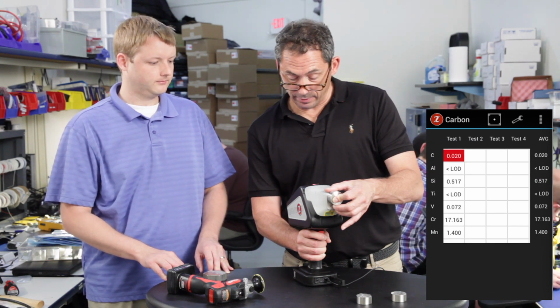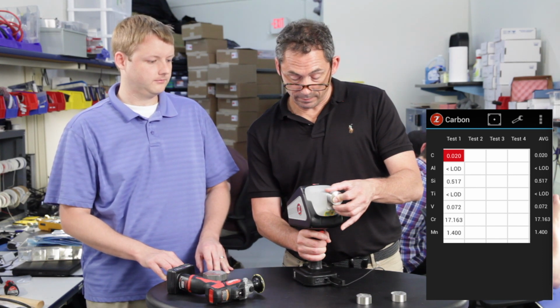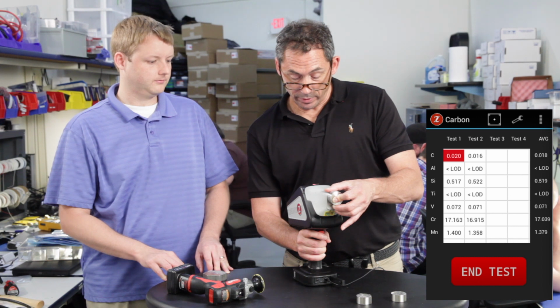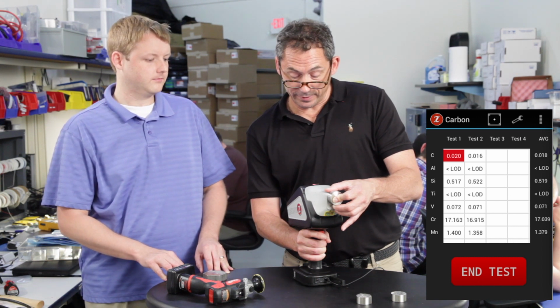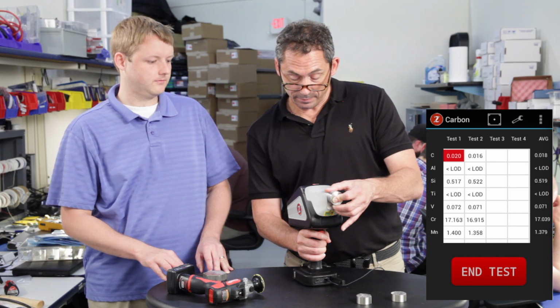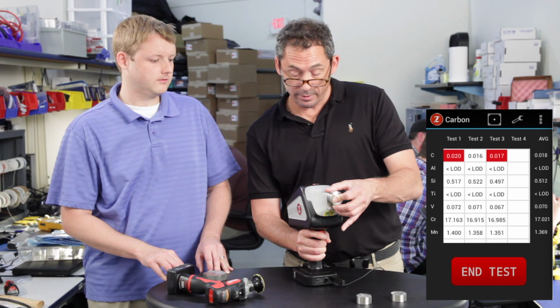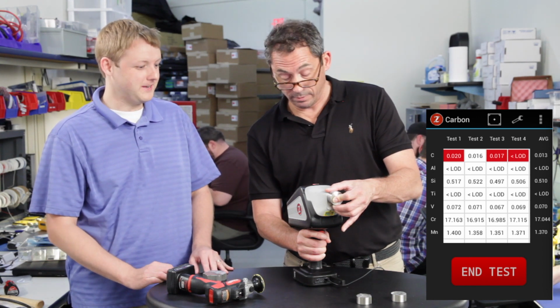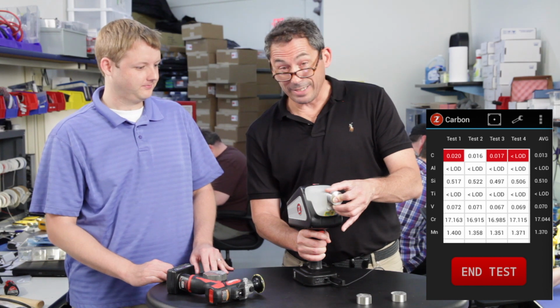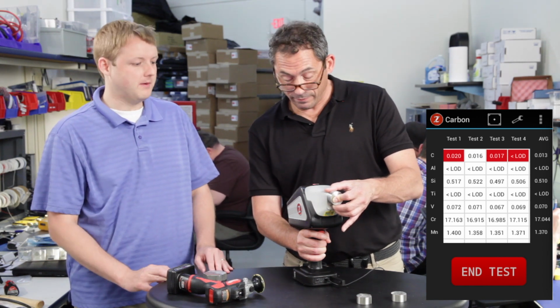Oh, look at that. That is a thing of beauty. Do another test. We can just keep testing, looking at the results. So this is another 316L we're shooting. Haven't moved it. Very repeatable results on that carbon. You did a great job. I am really impressed with this. Well, thank you. So less than LOD means it's coming in less than about 150 ppm, we think, 015? Yeah, about that.